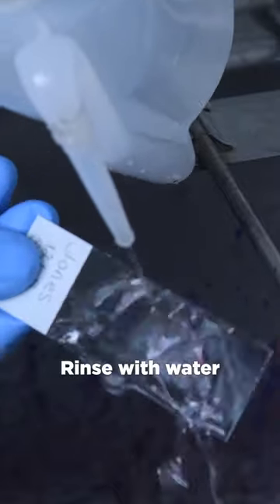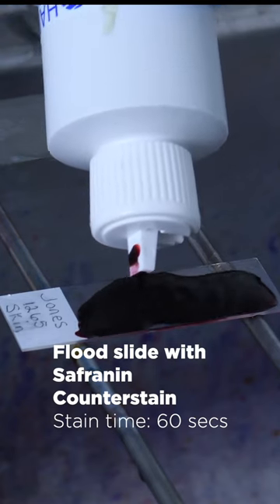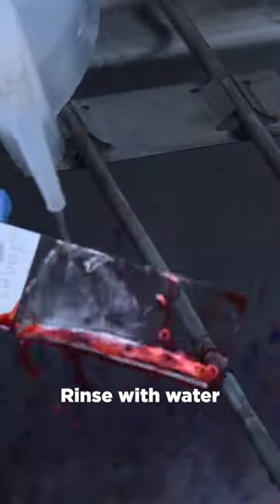Rinse slide with water. Flood slide with safranin counterstain for 1 minute. Rinse slide with water.